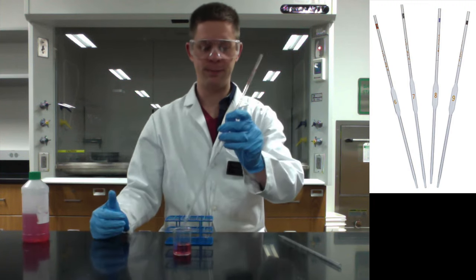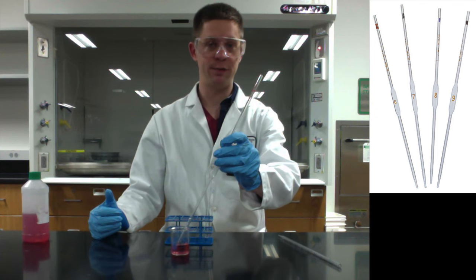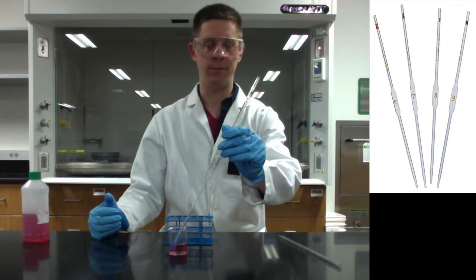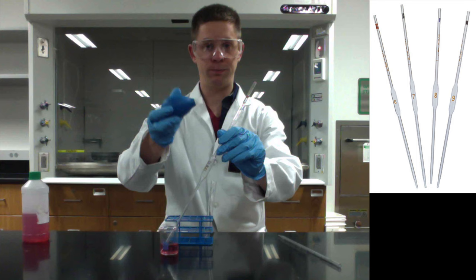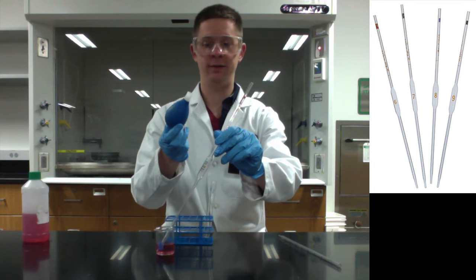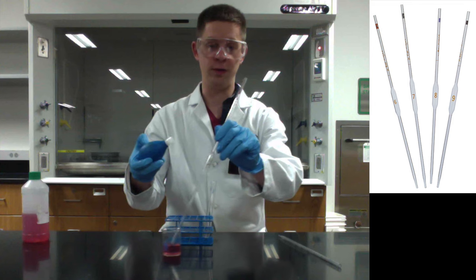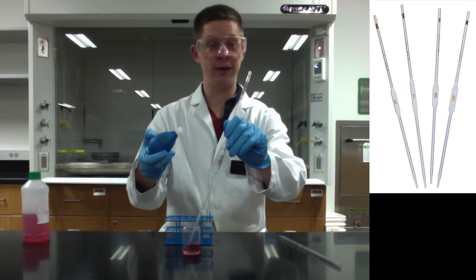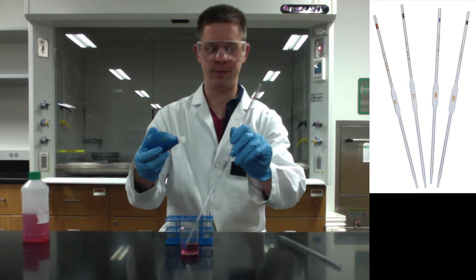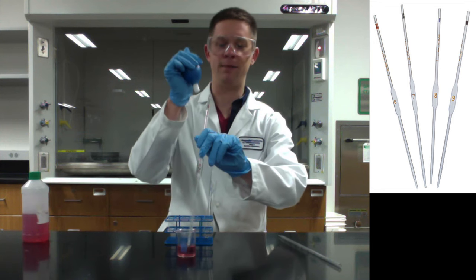To use a volumetric pipette, first stick the end of the pipette in the liquid. This device in blue is called a pipette bulb, and this is what actually supplies the suction to pull liquid up into the pipette. In the old days, people would use their mouths to do this, but do not ever pipette by mouth.